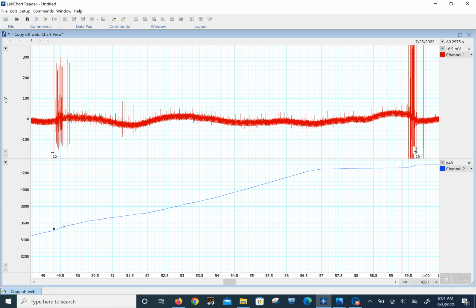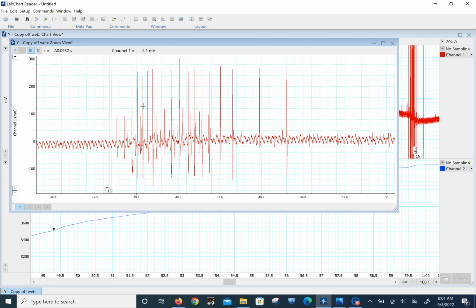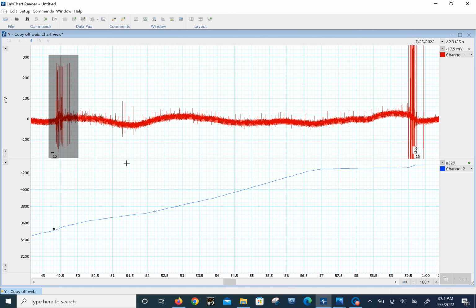1, 2, 3, 4, 5, 6, 7, 8, 9, 10, 11, 12, 13, 14, 15, 16, 17, 18, 19, 20, 21, 22, 23, 24. About the same number, you know. 26. Yeah, but you see what happened is that somehow it's counting a lot of the noise because the baseline's more wiggly.